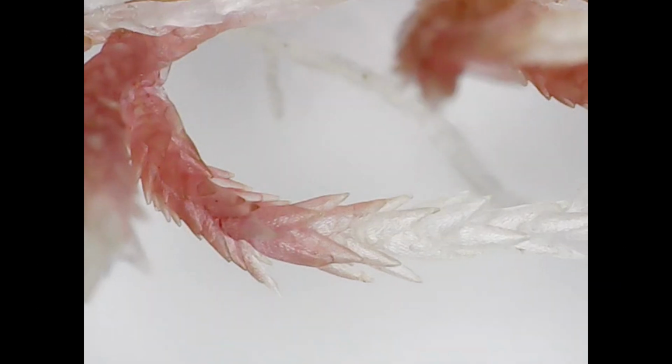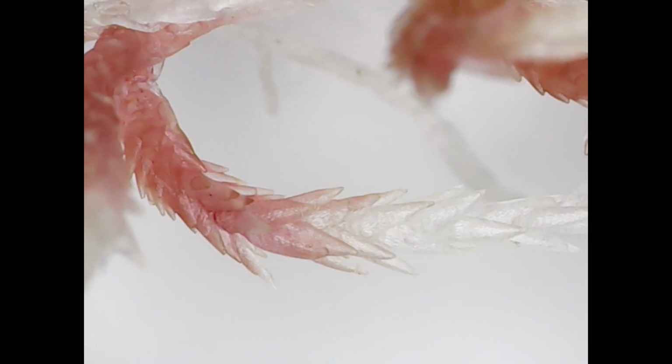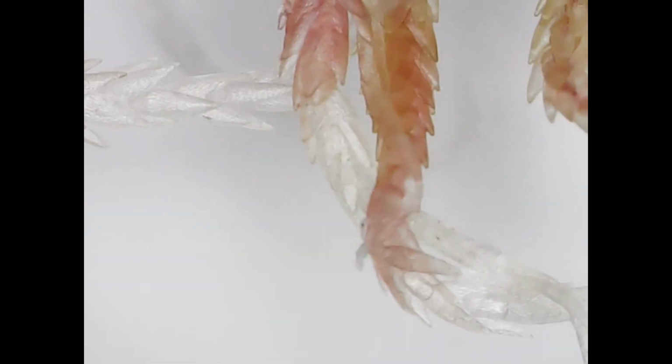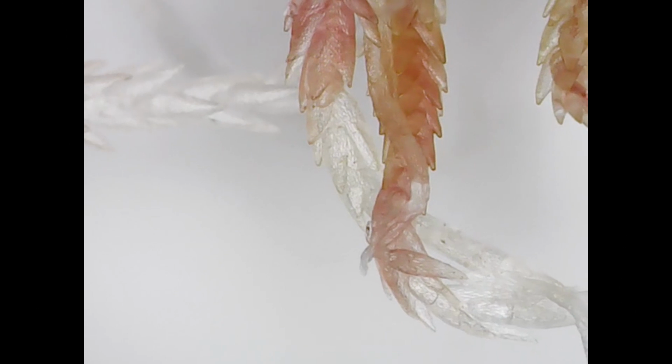Obviously, throughout the whole video, you're going to see me trying to focus a bit as well. Hopefully, I was able to minimize that as much as possible, but it's really interesting here to see that at the very tip it's actually almost entirely clear, which I think is really, really cool.